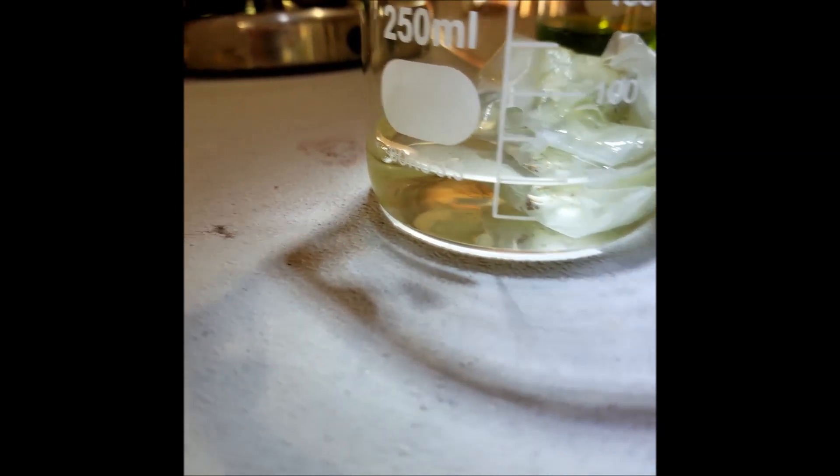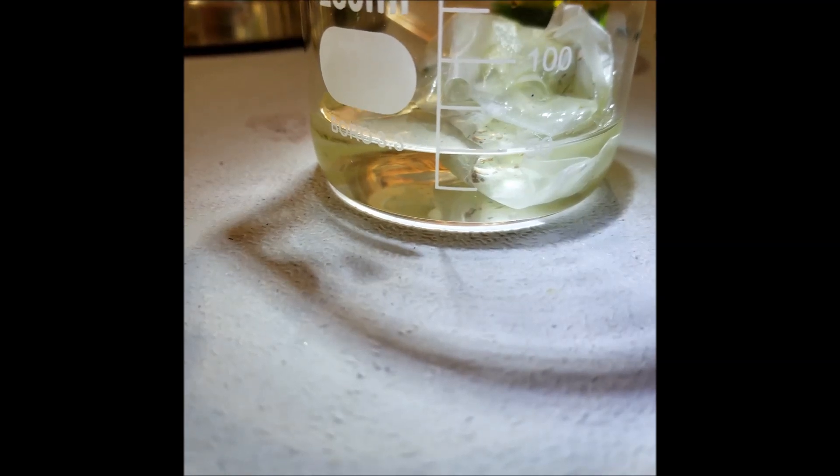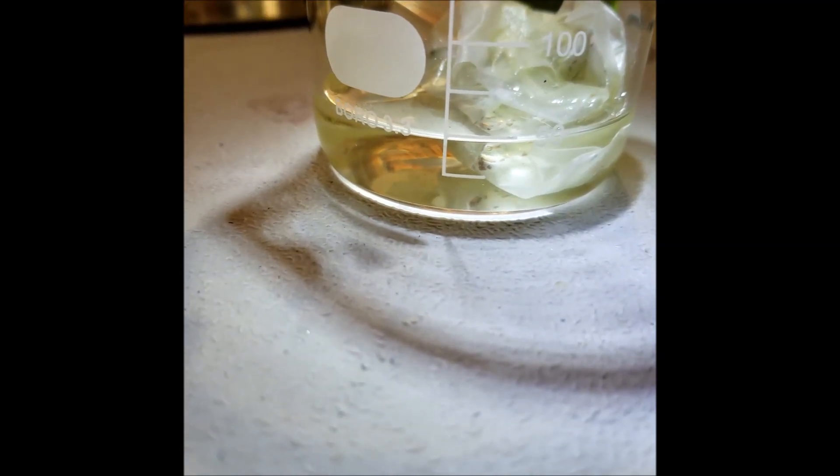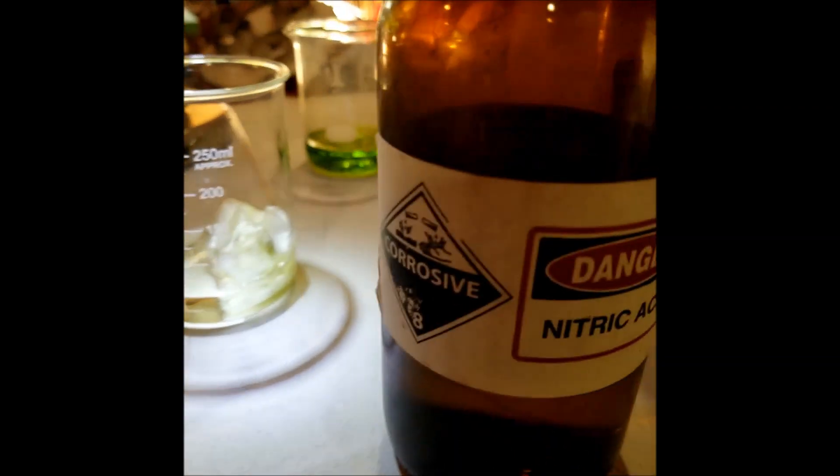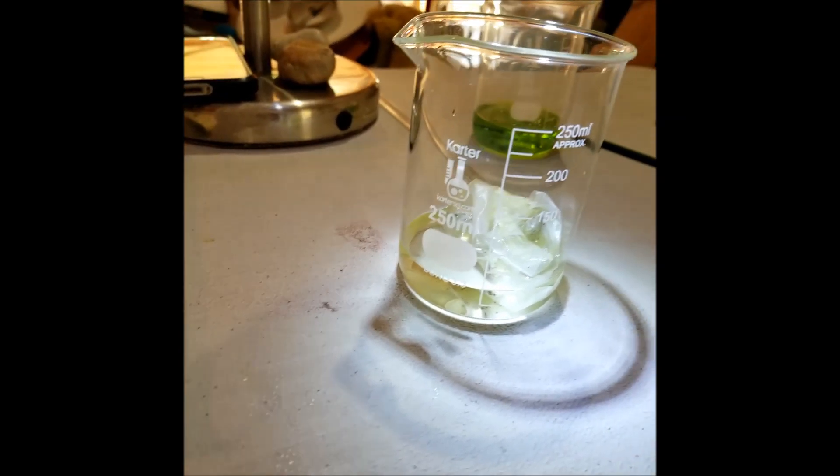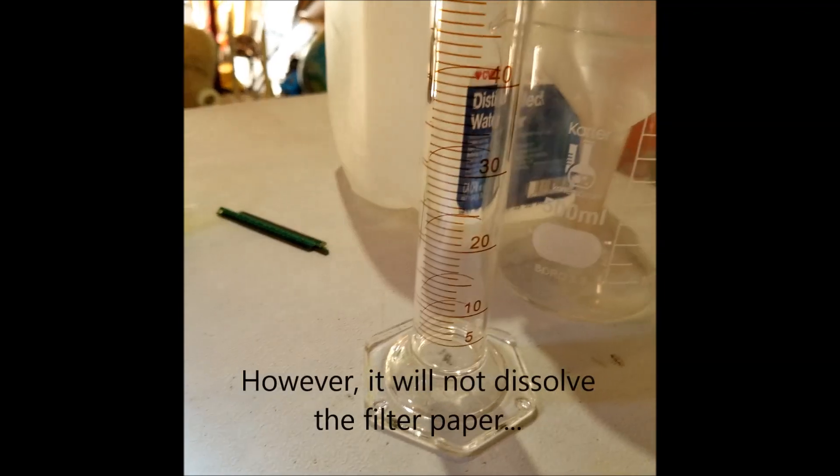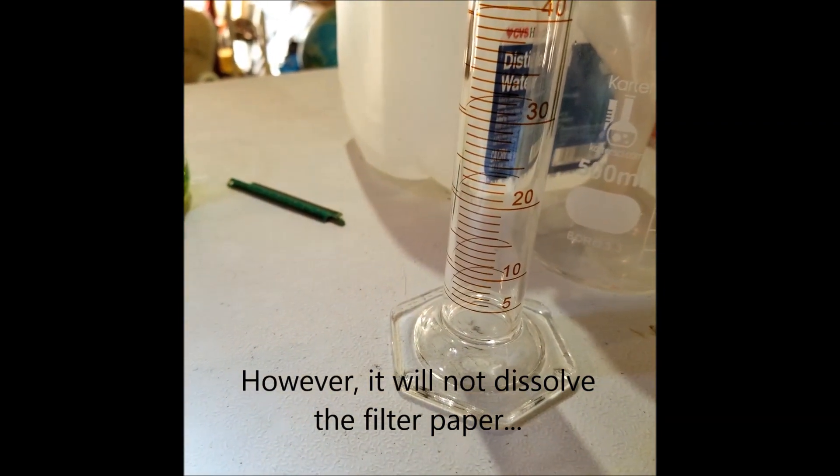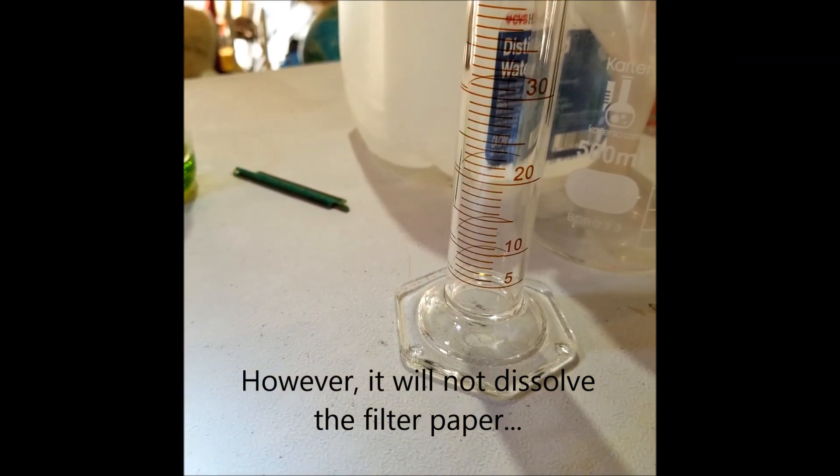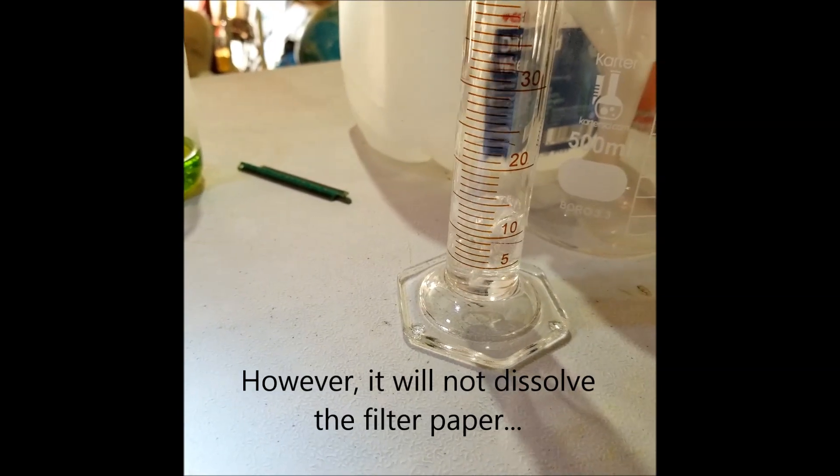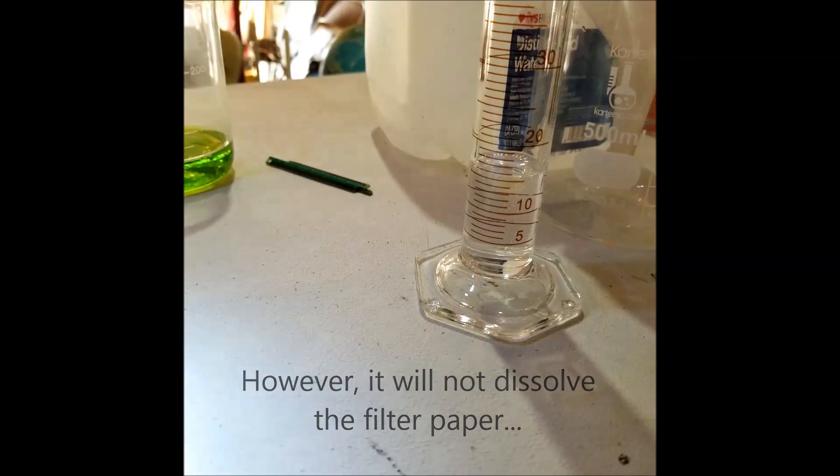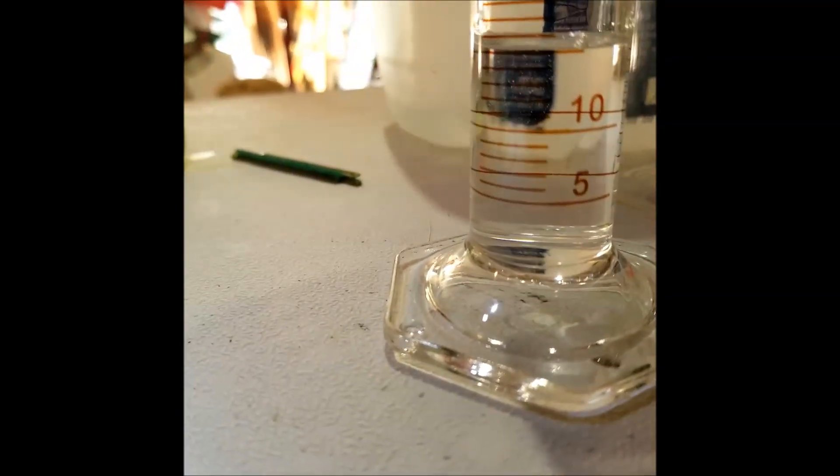And then we're going to add 15. There goes the cap. Here's our nitric acid, and I'm going to add 15 of that right here. There we go, 15.